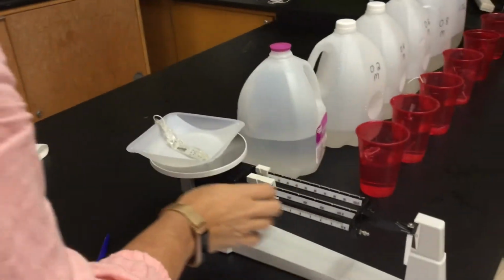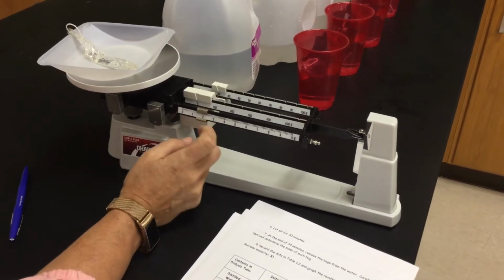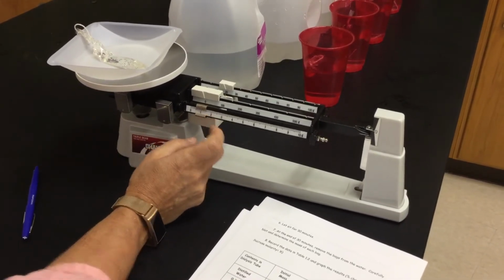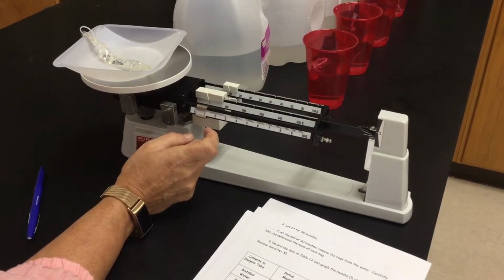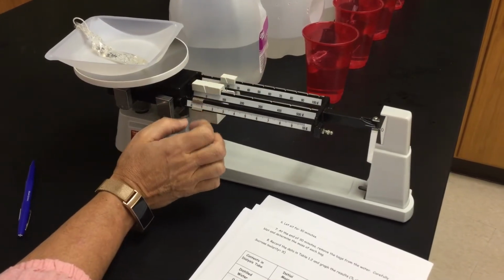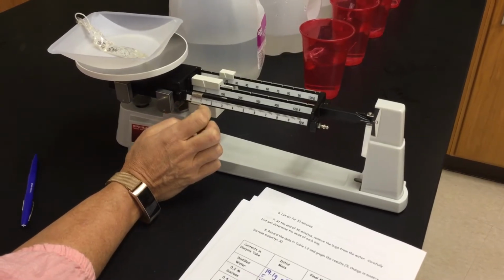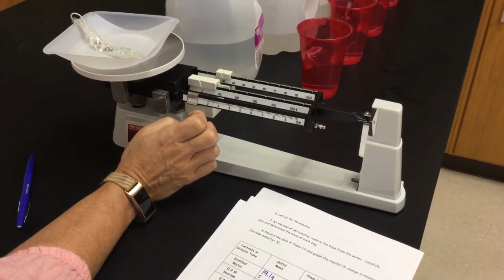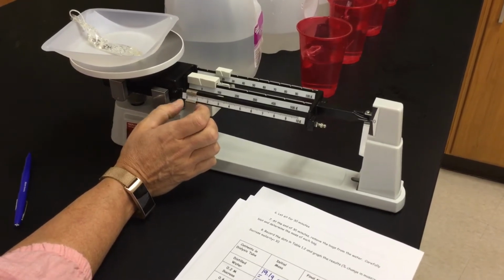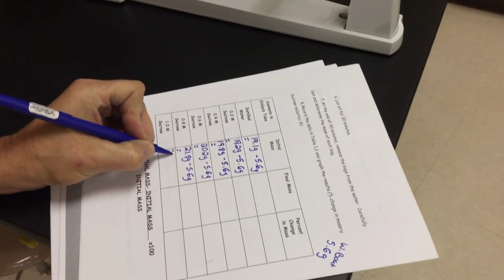Good, going in there. We're gonna go back to about 20, a little bit less. So either this bag's a little shorter, got a little less in it, which is fine. We're still going by our masses here. Let's go 20.5. So my initial with the weigh boat is 20.5 grams.